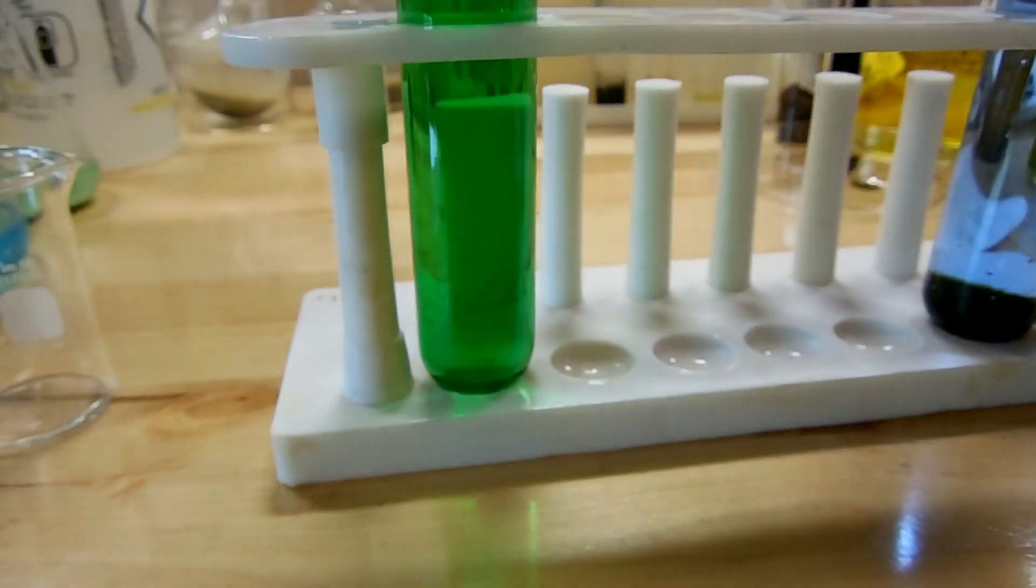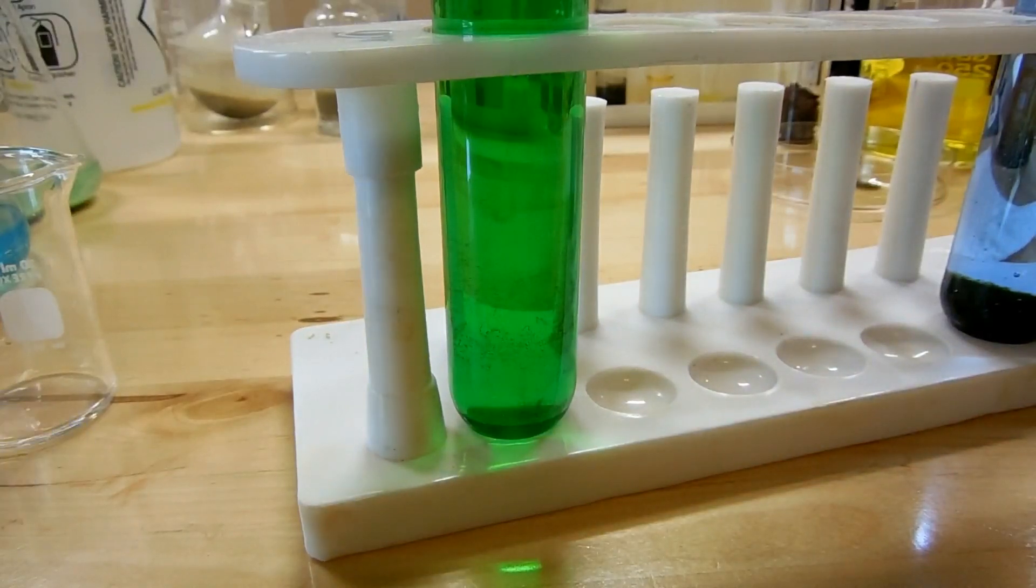So now to actually produce the Chevreul's salt, what we need to do is heat this, heat it to boiling for several minutes. So let's do that.